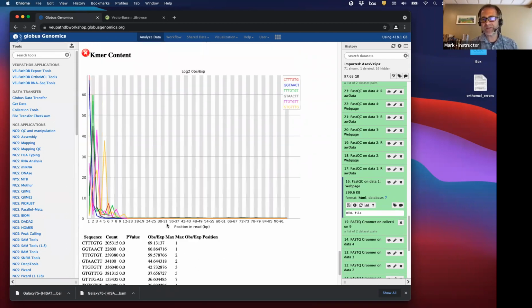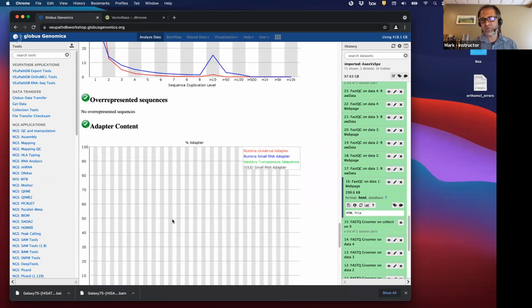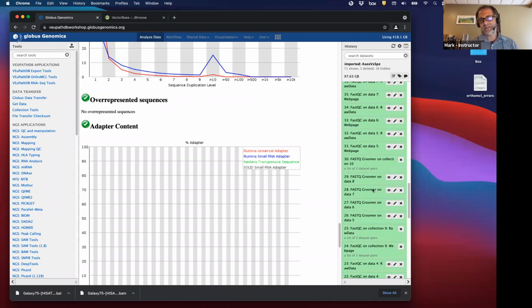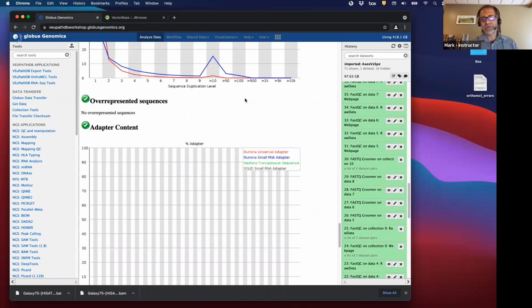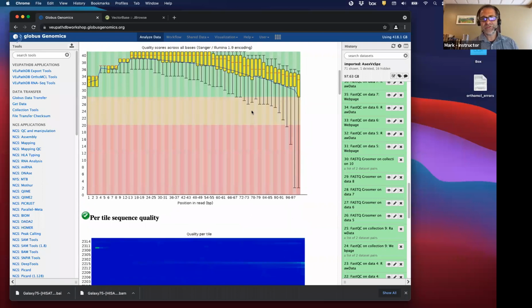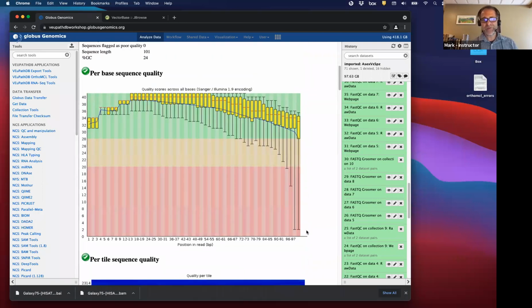So in general, that's what FastQC tells you, okay? The quality of your FastQ, your data and your reads. All right, that's good. But you notice that up at this graph above, there are some reads with this huge error bar at the end. There are some reads, especially at the ends of the read, that have very low base quality. Okay, we want to get rid of those because the sequencer wasn't very confident in making a base call.